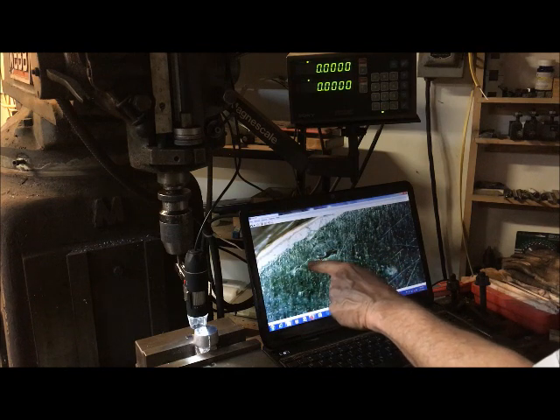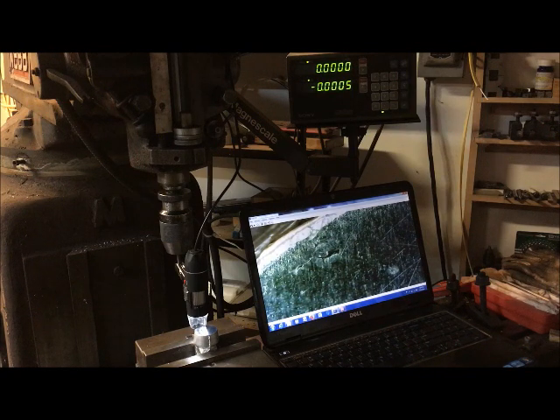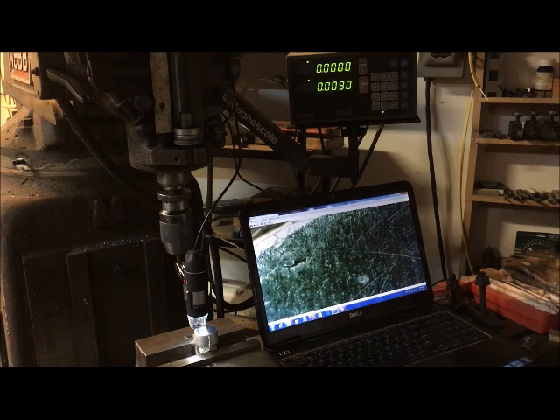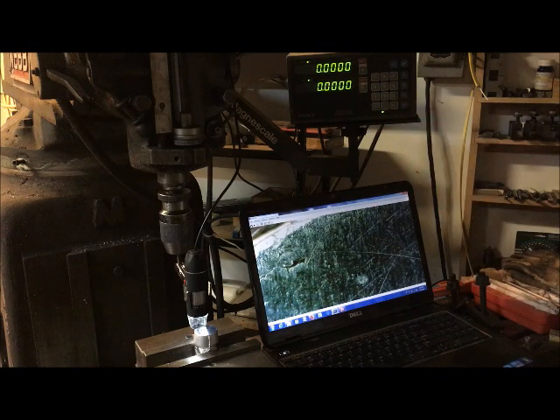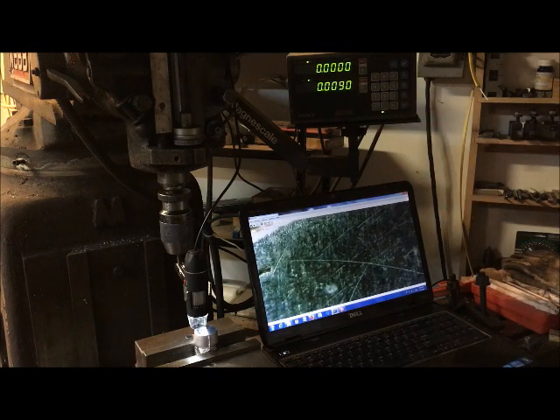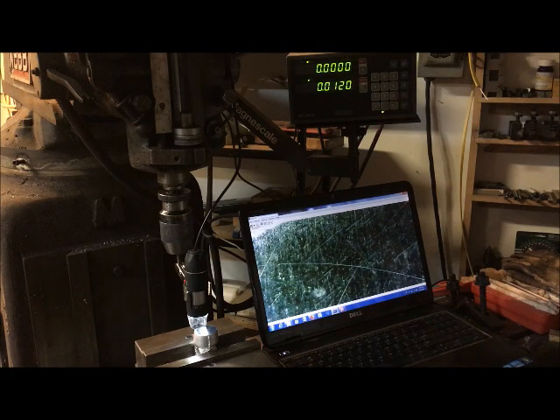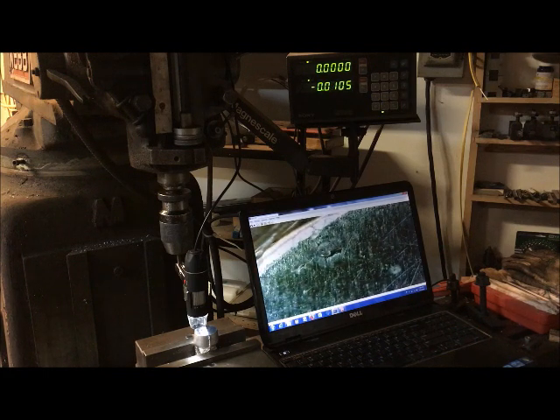This is really one defect. That may be an associated one, but we'll measure the whole width. There's the beginning. And we're looking at about 4.5 thousandths by 12 thousandths. So, thank you very much.